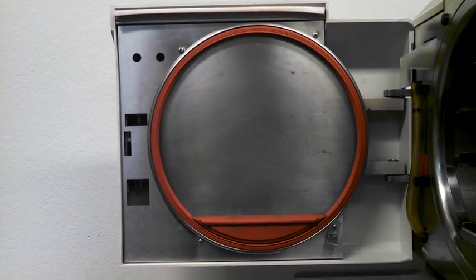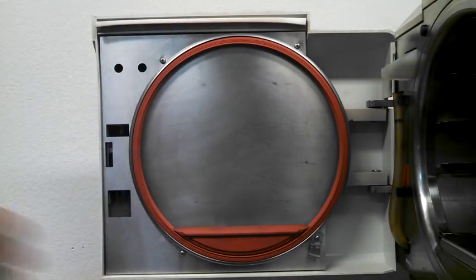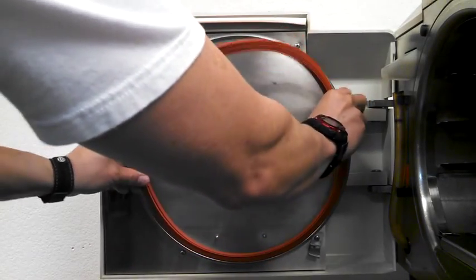A couple of ways you can tell if your gasket needs replacing is if it's loose, like the gasket that's here right now on the door. If you see an excessive amount of water under the unit, or if you see an excessive amount of steam coming out the sides of the door of the unit.